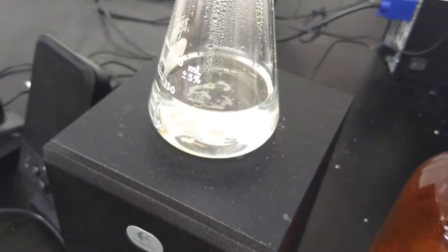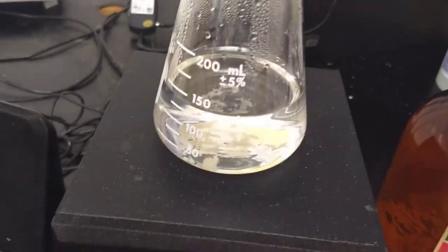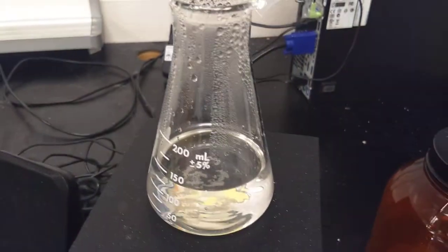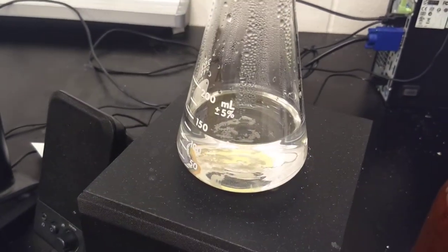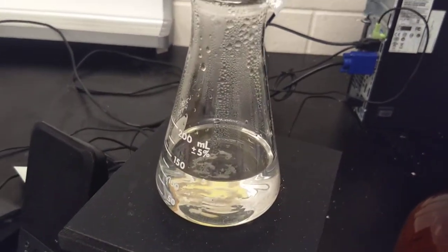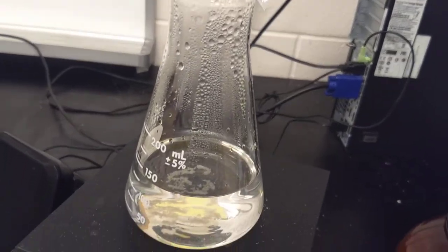Now, this is a supersaturated solution of sodium acetate, which means that there is really more sodium acetate dissolved in this solution than it can really hold. In fact, it is unstable. It is so unstable, it wants to crystallize back into its solid form at any second.